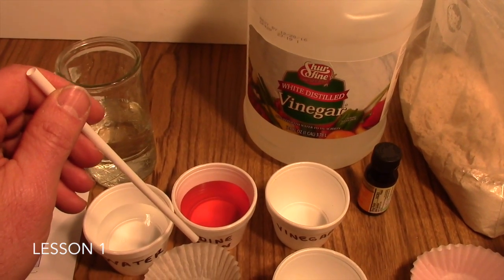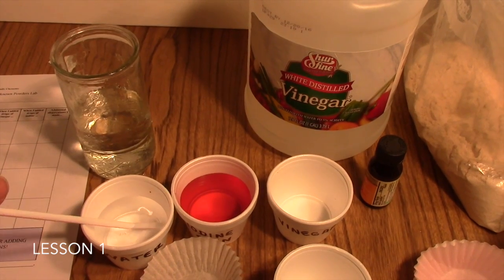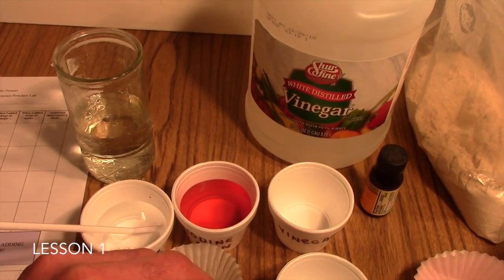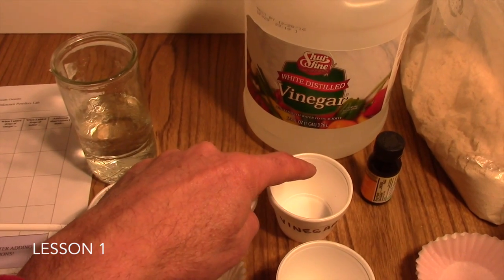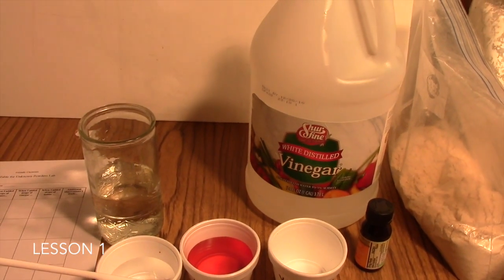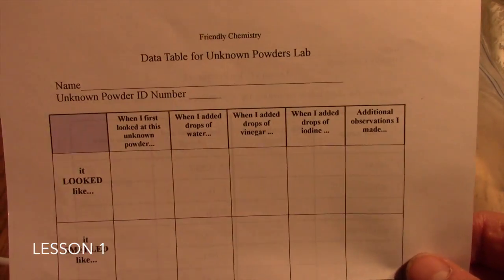Okay, and then you'll go into another one of your samples in your cupcake liner. You'll have another clean straw in the iodine, and you'll just take the straw and drop in some drops of the iodine, and then you'll do it again with the vinegar. With each of those, your student will then record their observations on their data table.